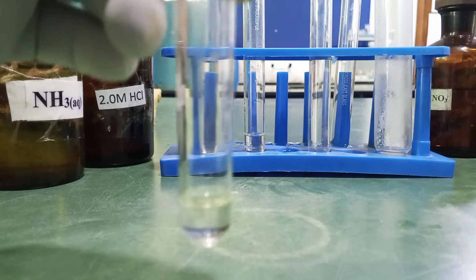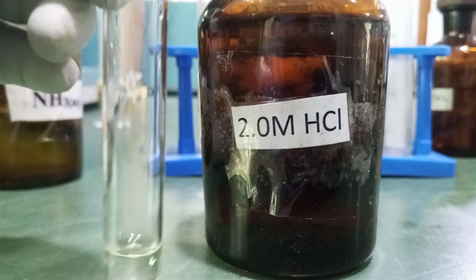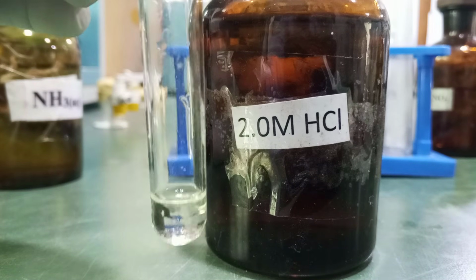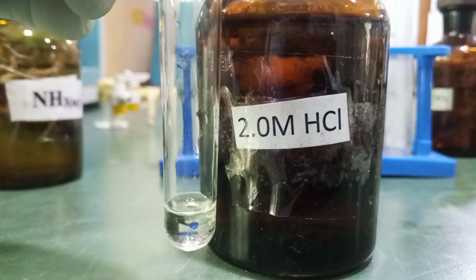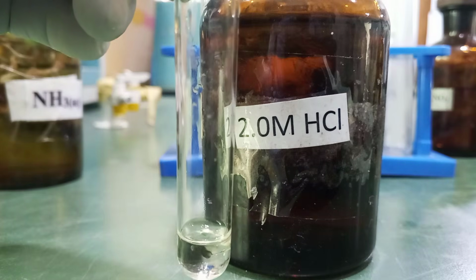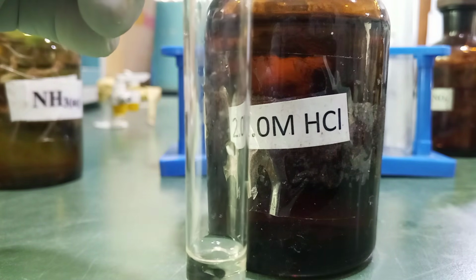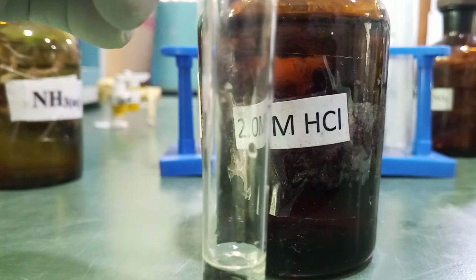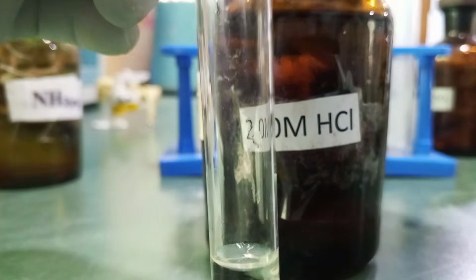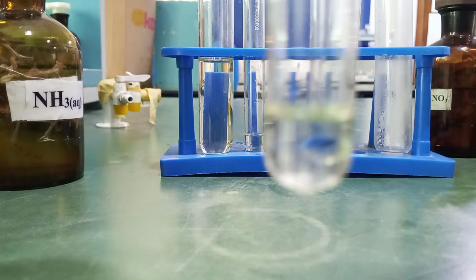using HCl. Right? With HCl, it's meant to give us a white precipitate of lead(II) chloride, which will dissolve on warming. If we put the white precipitate in hot water, it will dissolve to give us a clear solution, but on standing it will reappear. So let's just see what will happen if we add hydrochloric acid to this.